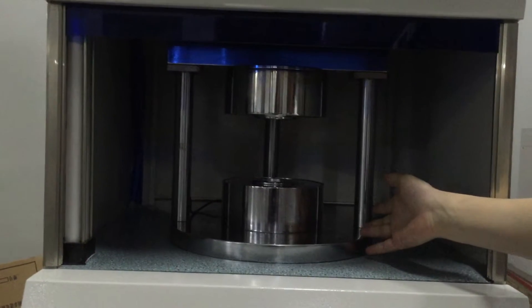In the chamber, there were two dies, the upper die and the lower die.